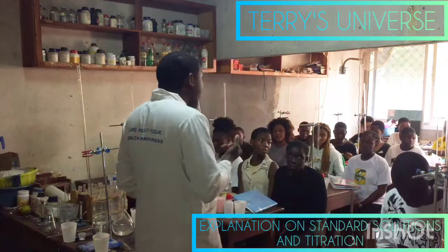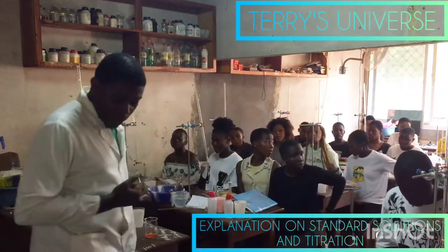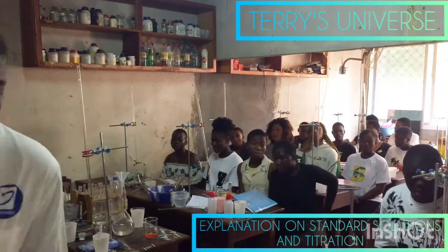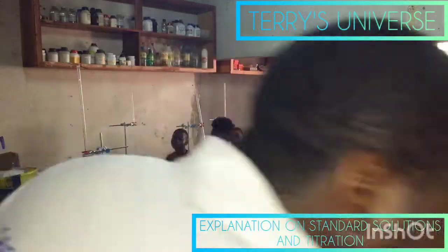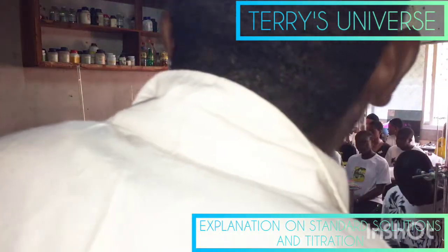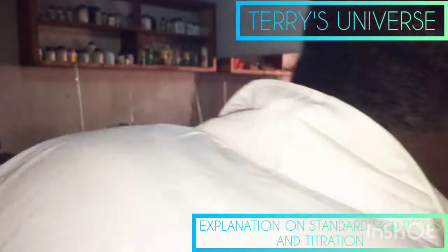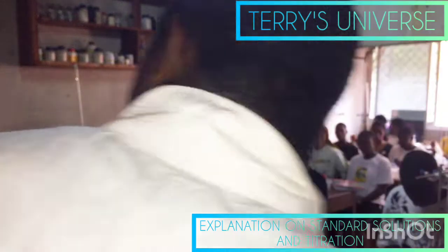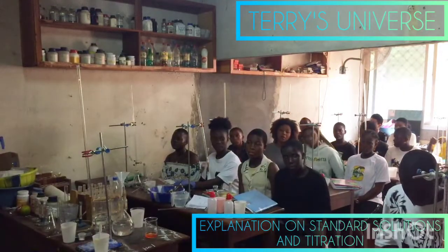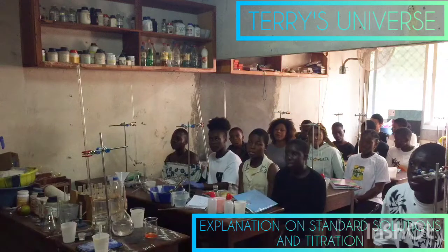You actually weigh out the mass of the salt, right? Yes. Using what? A weight balance. So this is our weight balance. I've already weighed all the masses, so you don't need to weigh the mass again. Mass of sodium carbonate: how many? 2.65.